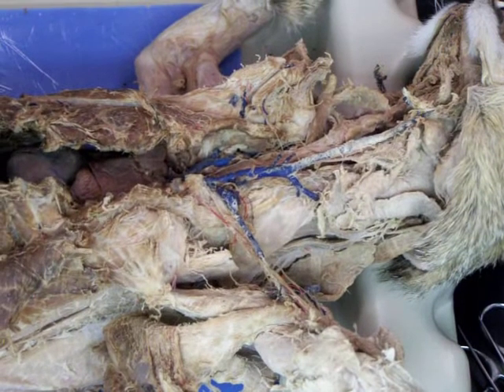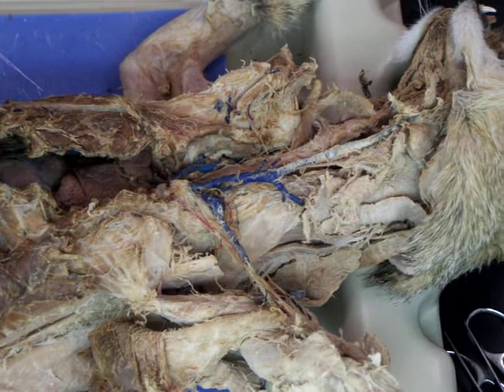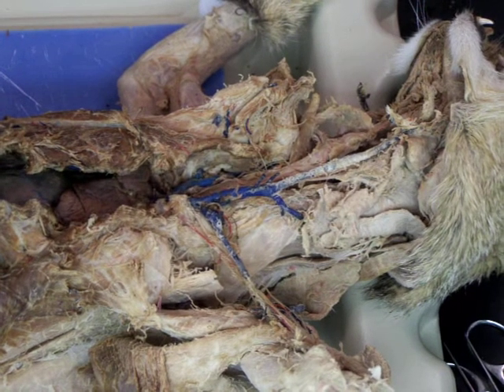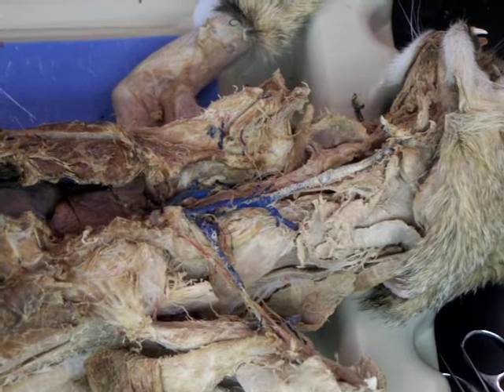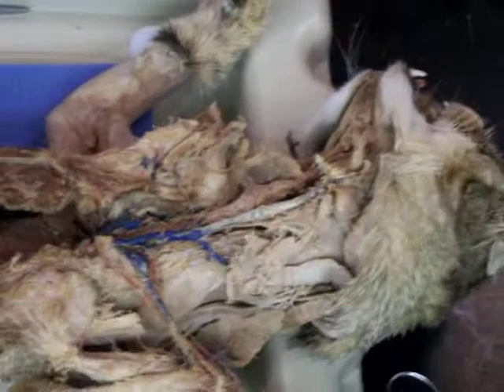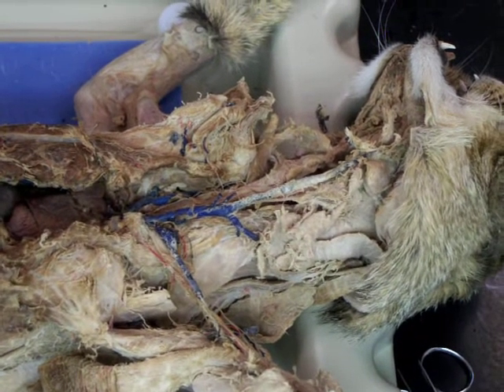The lingual, no, laryngeal. Laryngeal artery. And one other. I'm just guessing here. I don't know. Keep going back. Follow it from common carotid. Where's your map? Thyroid arteries. Did I already say that? Said that. Occipital artery. Okay, that's the one you didn't mention.